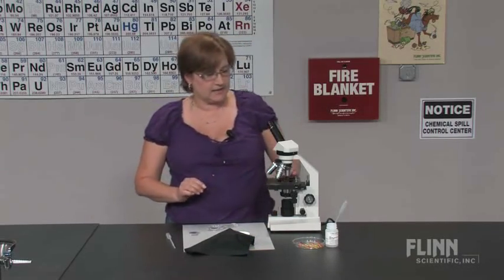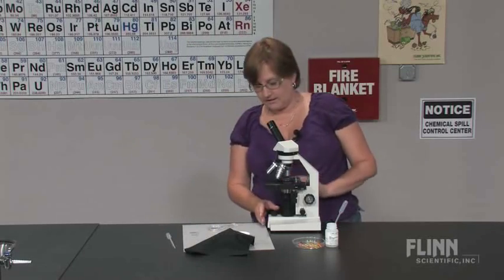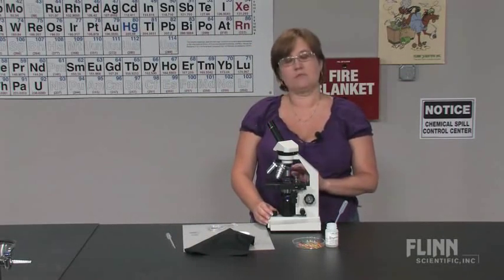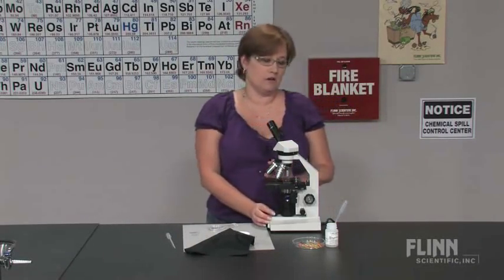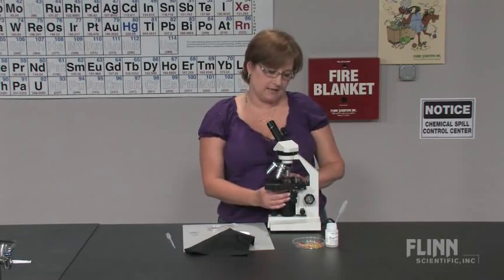Now I said that they like light, which is a great thing underneath the microscope because you can dim or illuminate them as you need.